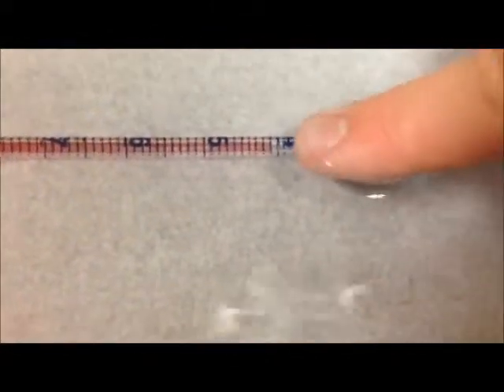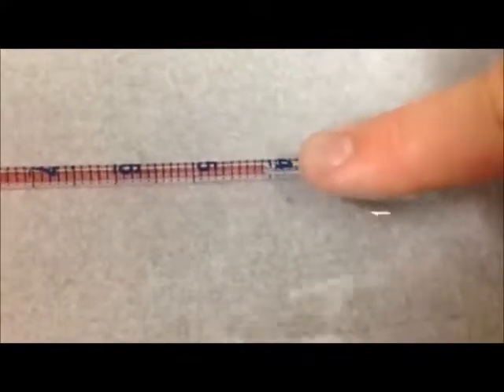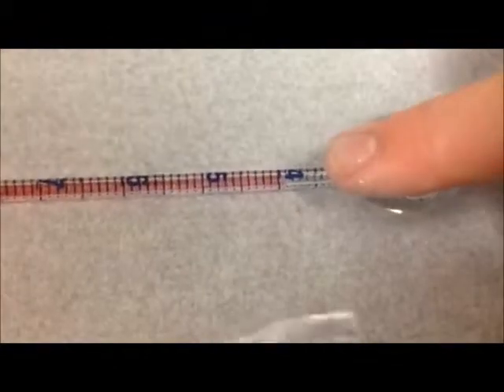In order to measure the respiration you look at the meniscus inside the pipette and where it fits along the dashes and measure to 3 decimal places.